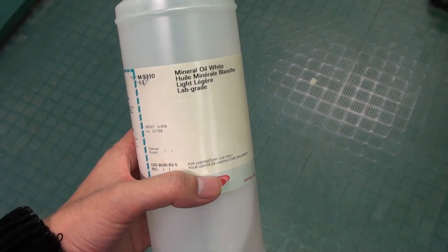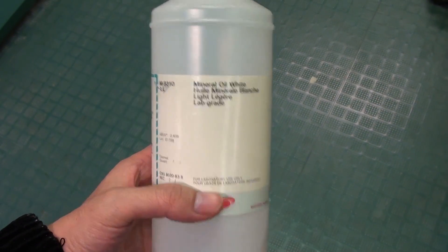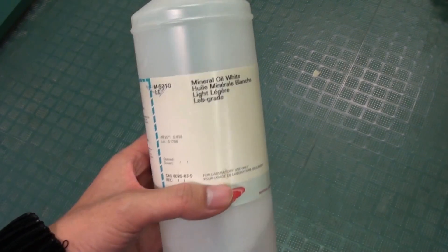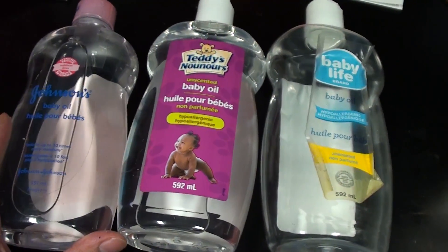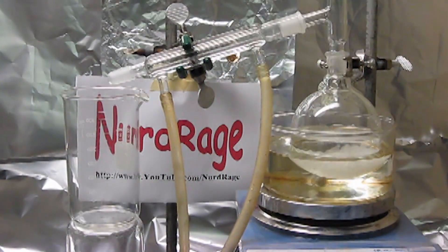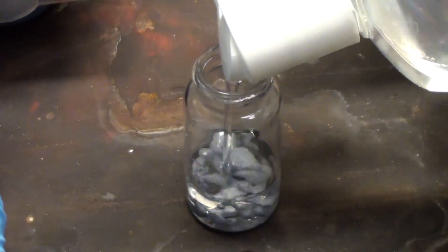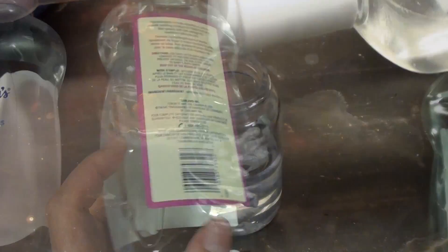Normally it can be purchased very cheaply as mineral oil or paraffin oil. But there's also a very simple and easy to get source for the amateur: baby oil. Baby oil is actually a highly purified paraffin oil, so if you need to make an oil bath for chemical reactions or to store reactive metals, you can do so with baby oil.